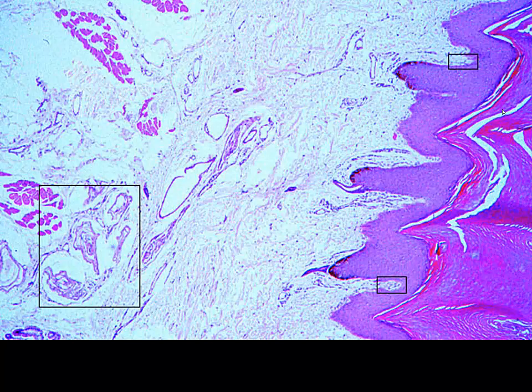Now here we're looking more in our dermal layer. We can see, again, we've got our dermal papillae coming up, epidermal papillae coming down. We've got a duct of a sweat gland here. We've got some more ducts of glands, some muscle running through here. These look like deflated little concentric ring structures. These are our Pacinian corpuscles. They've been sort of wiped out from the preservation, so they're kind of collapsed down in here. But that's what we're looking at, the Pacinian corpuscles.